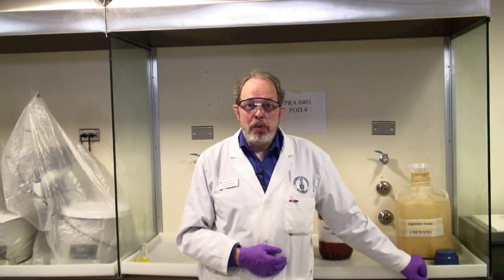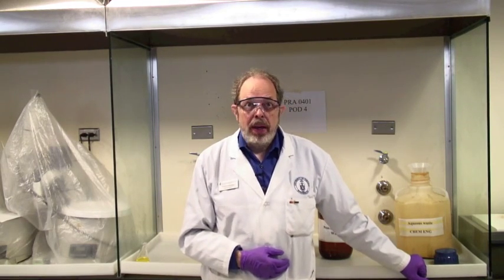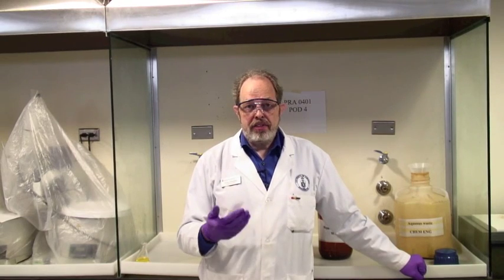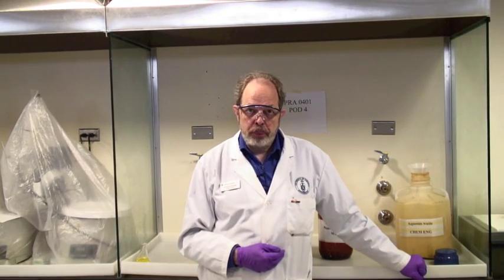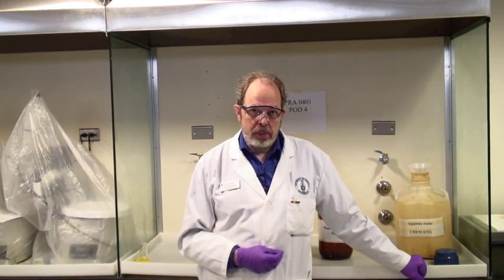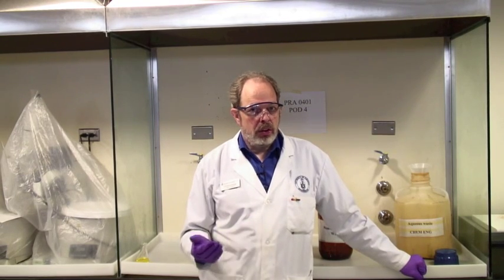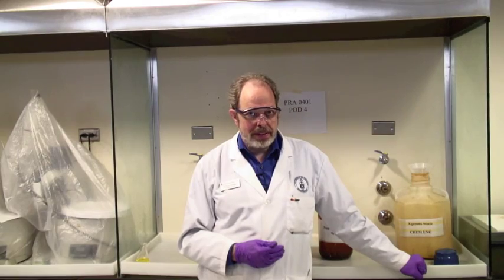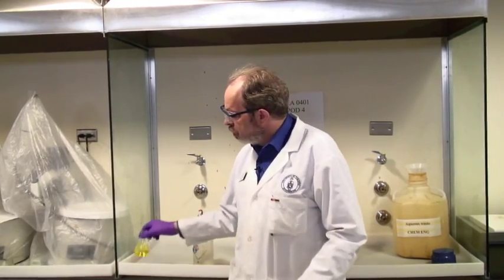As you know, the rule around here is you make a mess, you get to clean it up. Every day you will be needing to clean up after your experimental work. This video is talking about cleanup when you're in the inorganic portion of the course and everything is water-based. You'll probably end up with a lot of solutions.